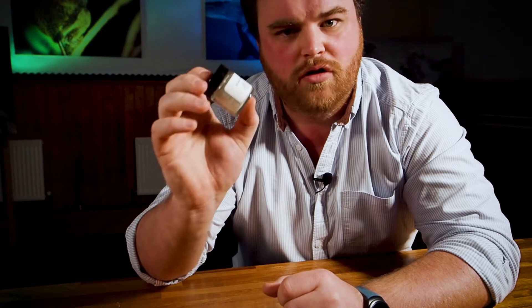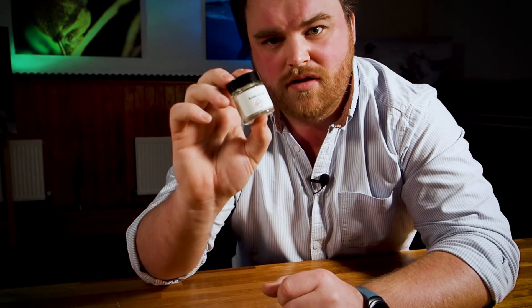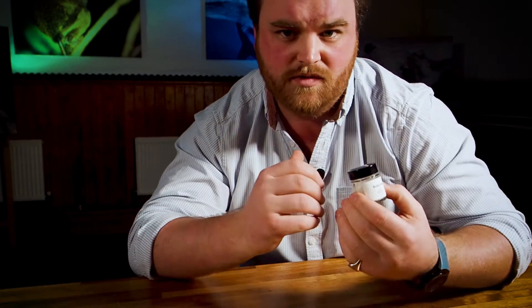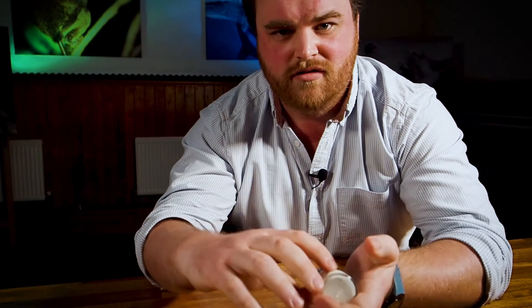And that is where this stuff comes into play. This is soda lime — a mixture of sodium hydroxide and calcium hydroxide — which is used in all kinds of situations to remove carbon dioxide from the air. We can use it here so that all the carbon dioxide produced is absorbed, meaning that as you respire, the air pressure goes down. So all we need to do is put some of this in a sealed chamber, add some organisms, and set it up so we can measure the air pressure inside.